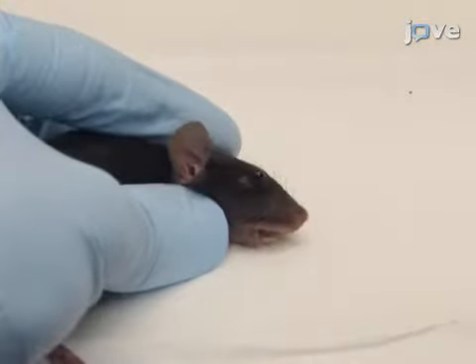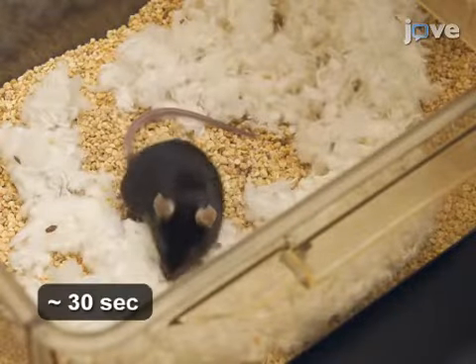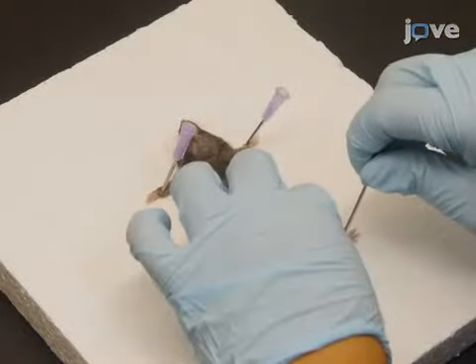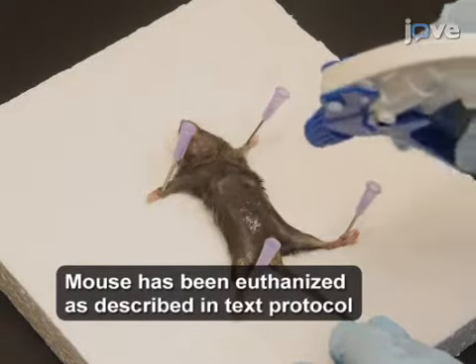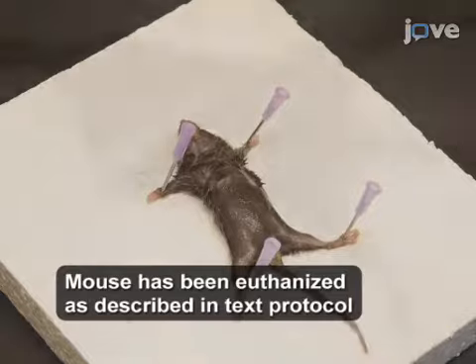Examine the mouse for any signs of injury, such as swelling or bleeding, and ensure that the mouse recovers and begins to walk. 5 days later, after sacrificing the animal according to the text protocol, use 70% ethanol to sterilize the mouse by spraying generously until the fur becomes wet.